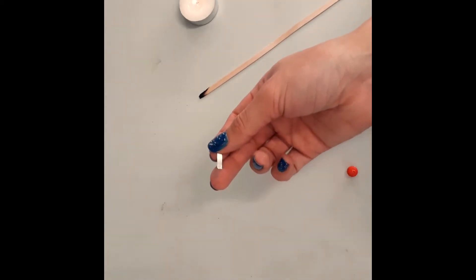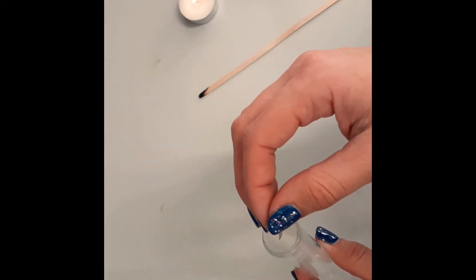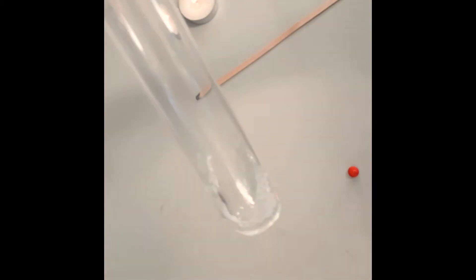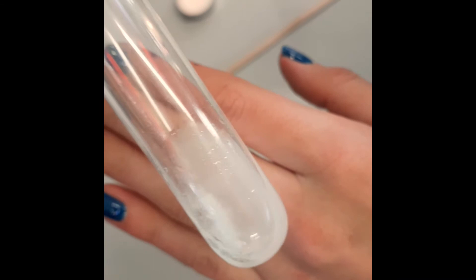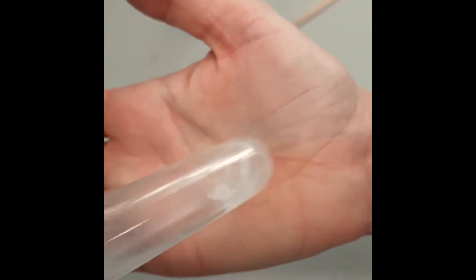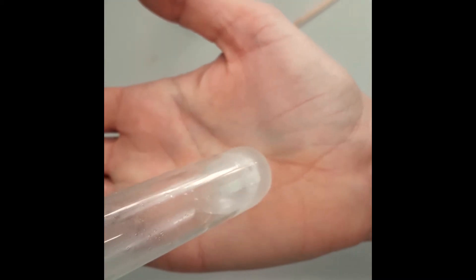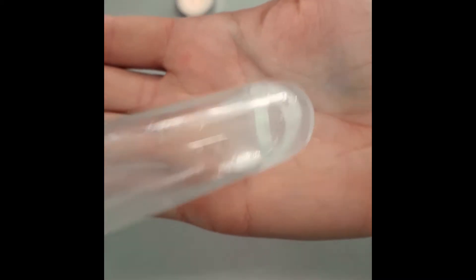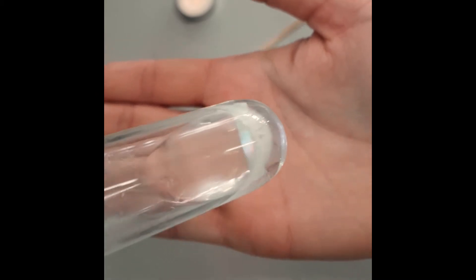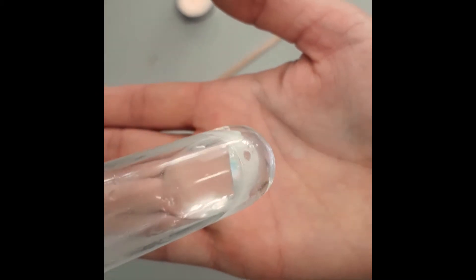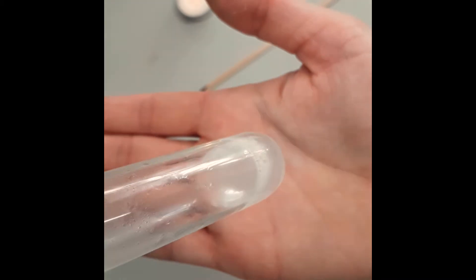So we'll see if we can hear anything, but I'll tell you what we're experiencing. So we're seeing some nice bubbles of gas fizzing. So here's magnesium slowly, slowly disappearing. It's getting smaller, getting bubbles of gas. And what I'm doing is just going to shake, make sure it can all react.